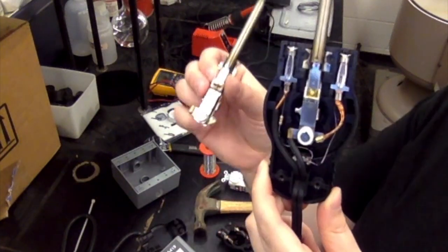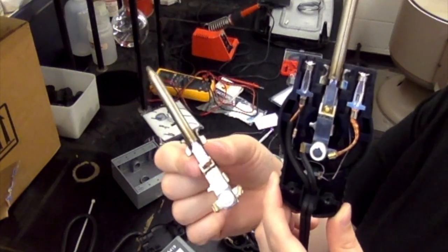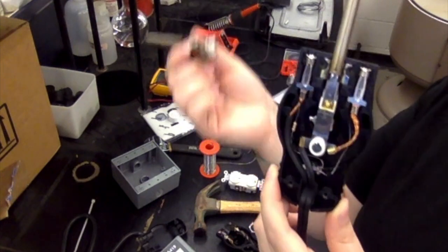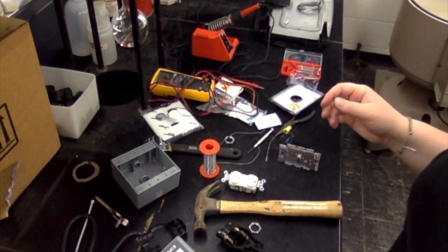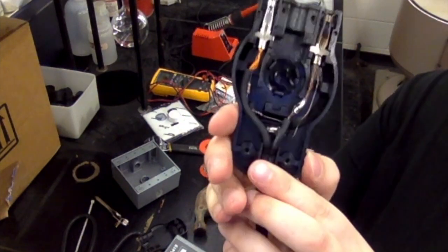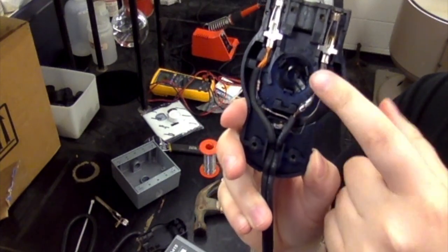This is what it looks like once you've taken it out. We don't need this piece for anything, so you can go ahead and discard it. We won't be using it in the future. So when you're finished, it should look something like this, and you can see we have the solder joint here with the 2 lines connected.